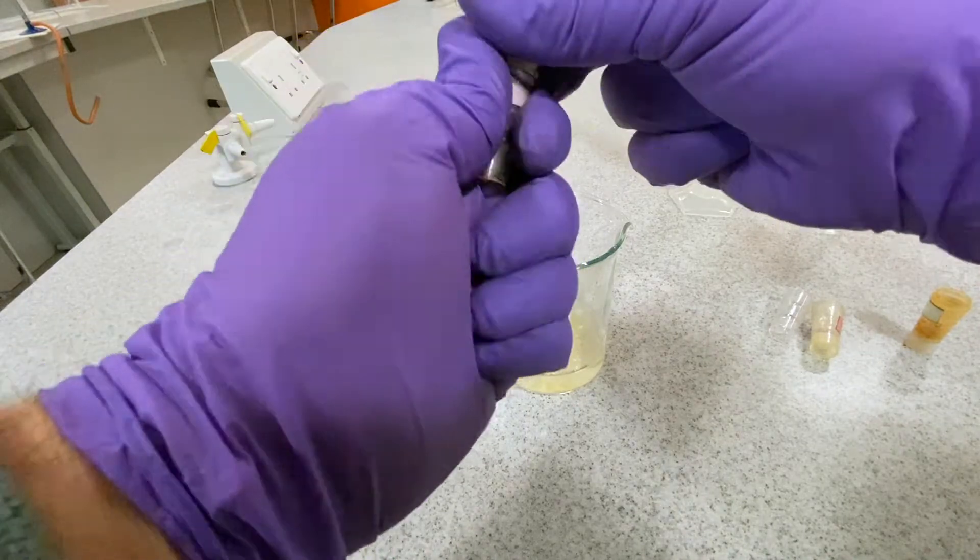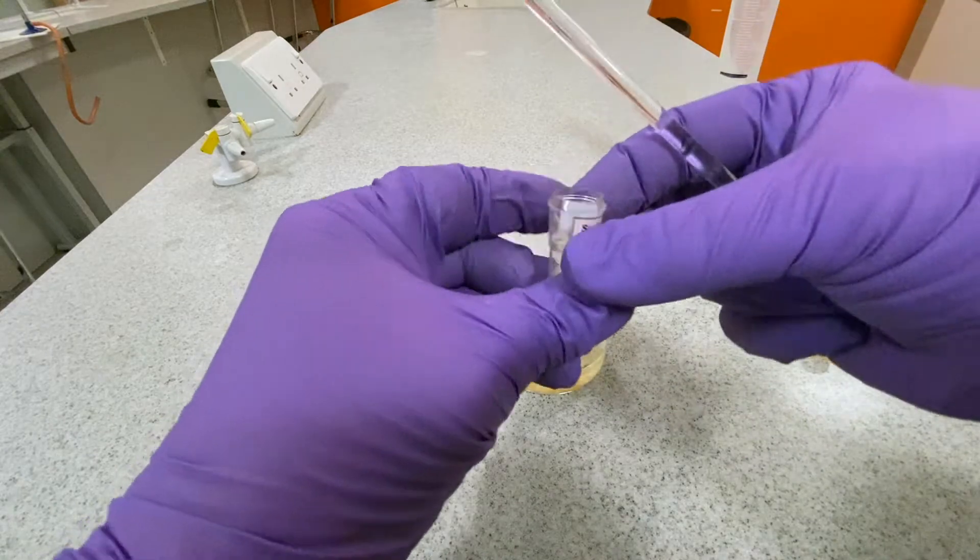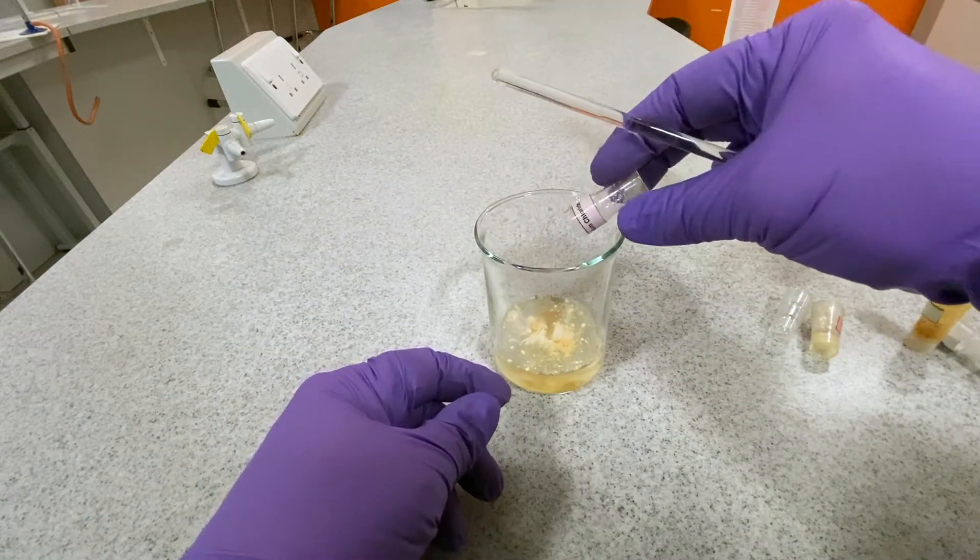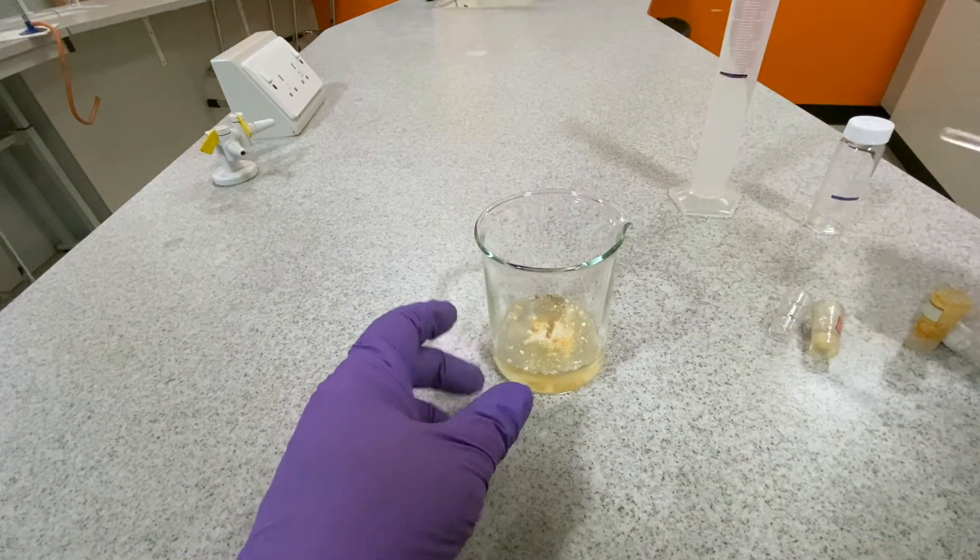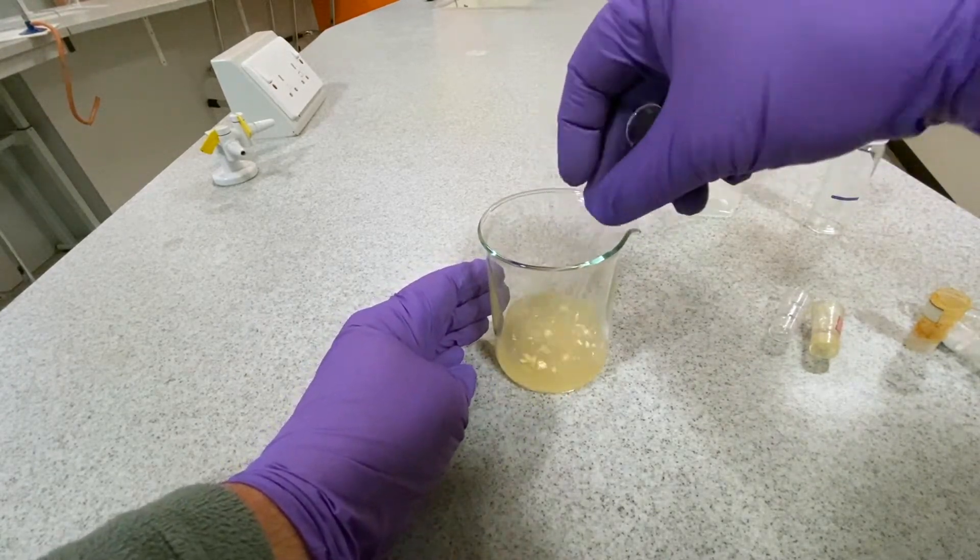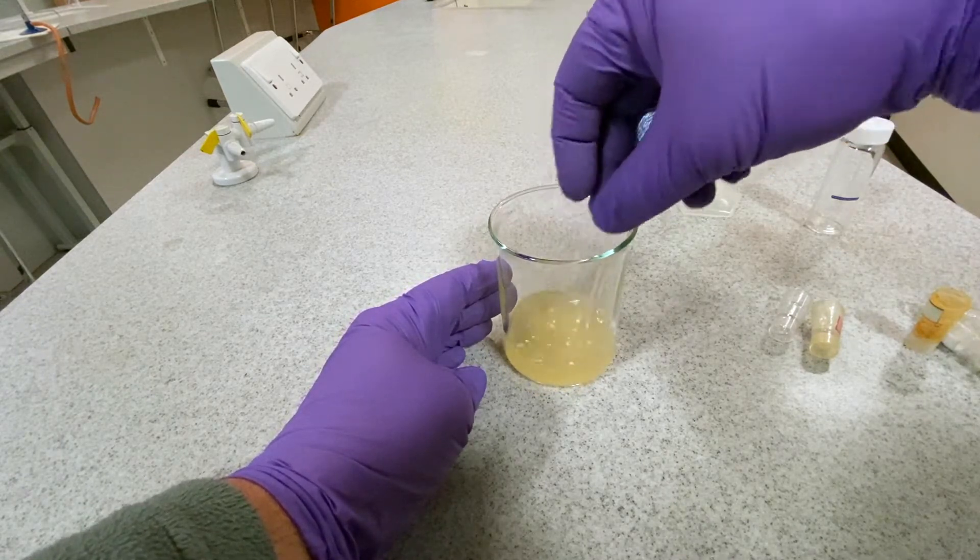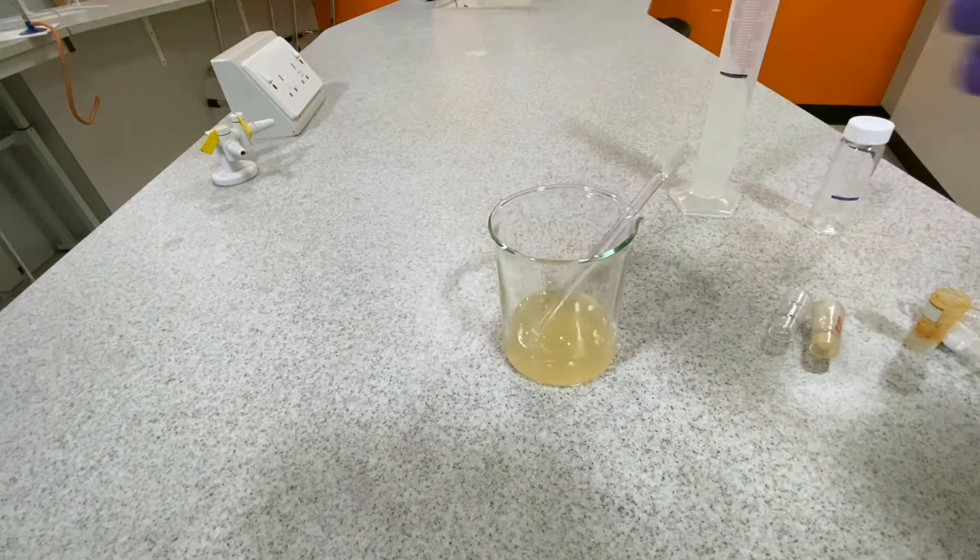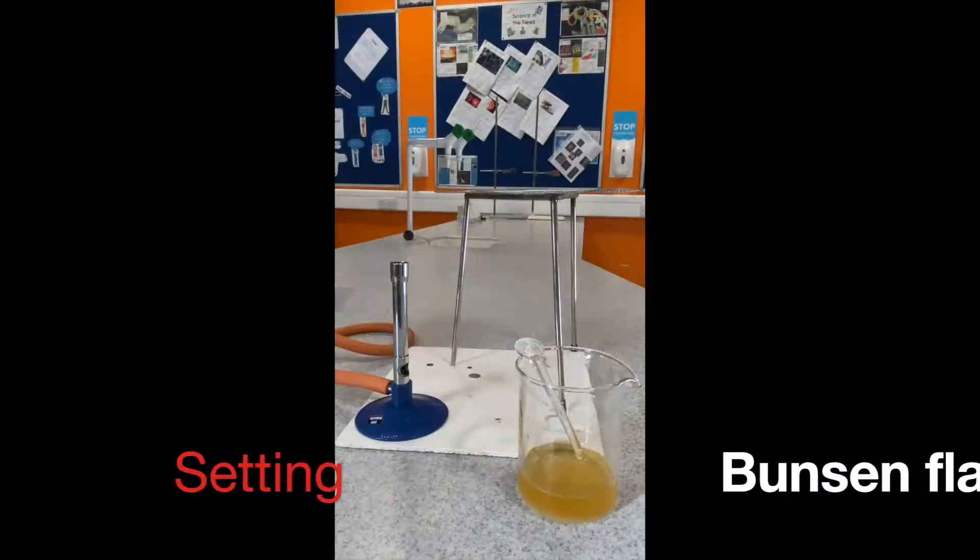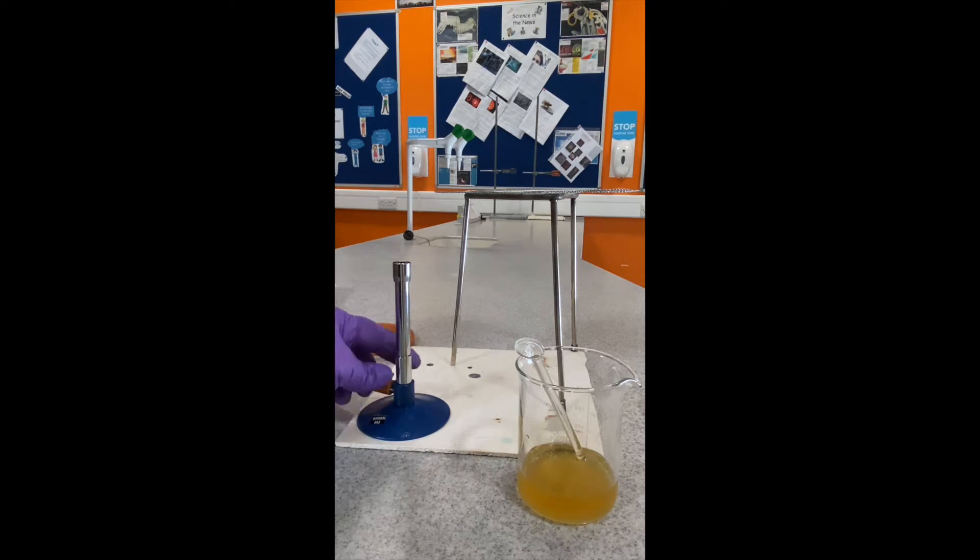Always add the solid ingredients to the liquid medium and not the reverse, as this will avoid any clumping of the ingredients. When all the ingredients have been added, stir them together.